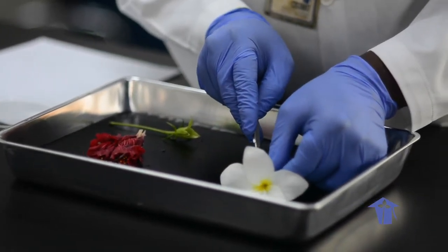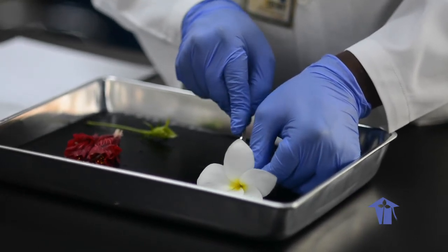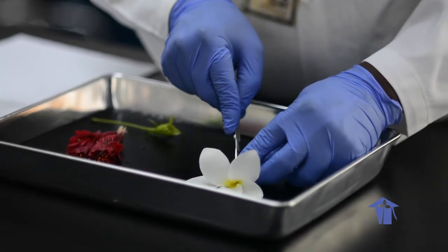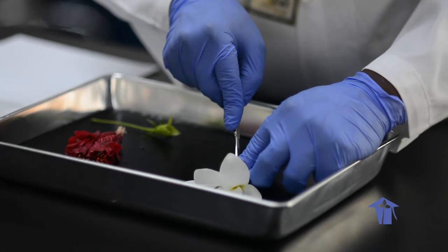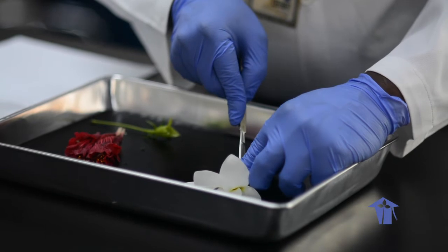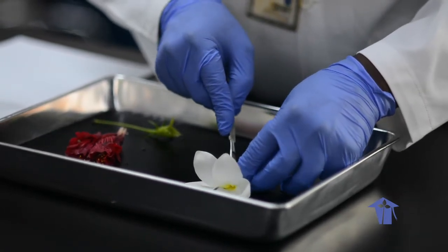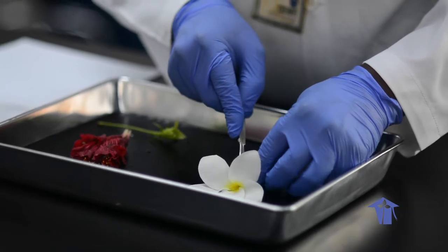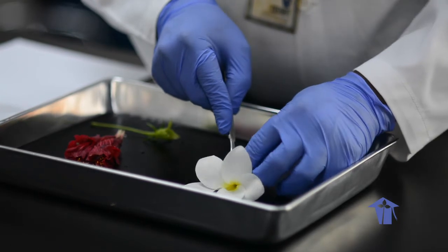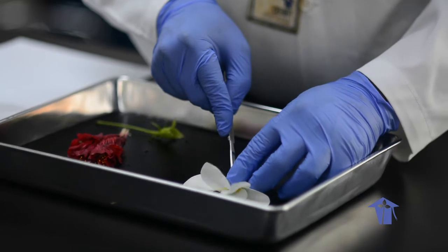Let me use this flower, which is in much better shape. And again, key with dissection, light cut and then separate. Right. So I'm going to use a light cut longitudinally. Try not to go too deep. Because a steady hand. Right. So here we're separating, and because these flowers are much fresher than the hibiscus, it's not separating as easily. So we don't get that separation.